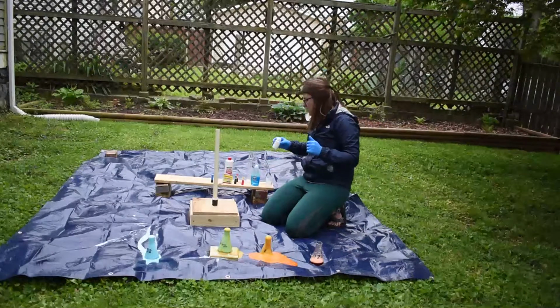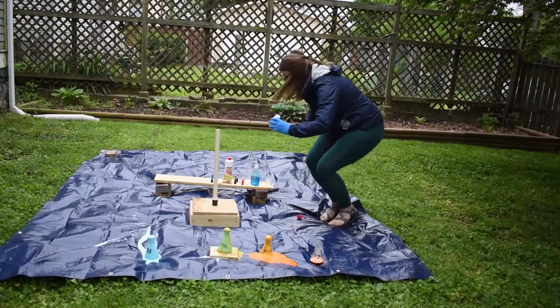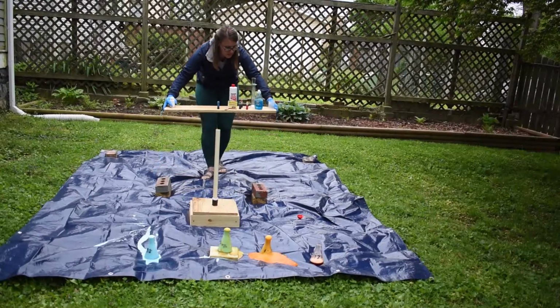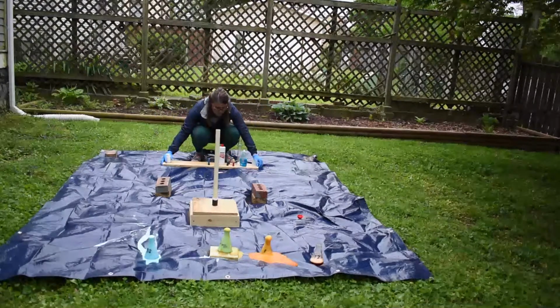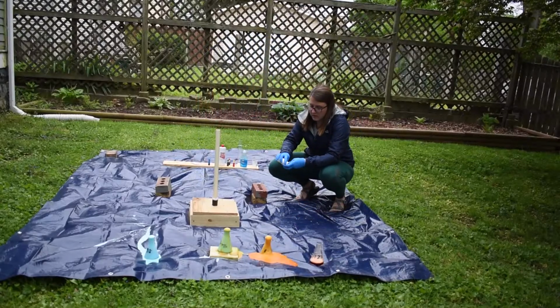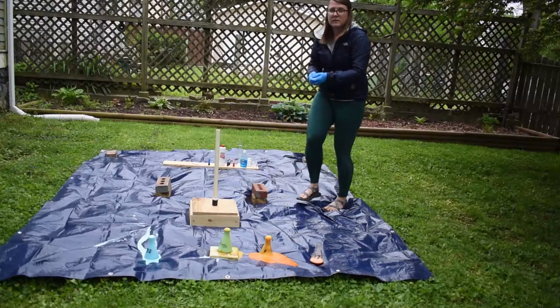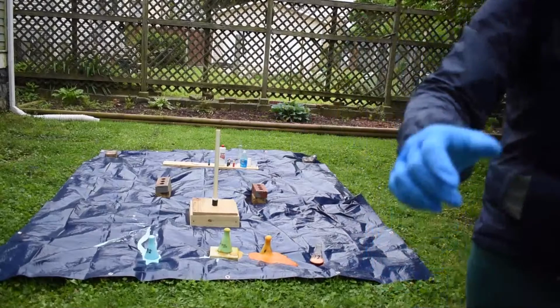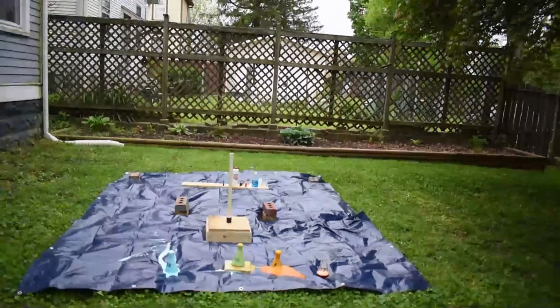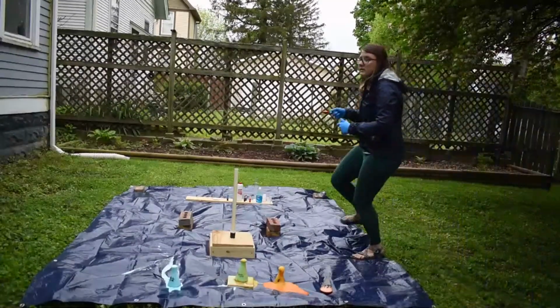So we've got that. We have the potassium iodide that I have left. I'm going to move back my other stuff just in case, because I have a feeling of all of these, this is the one that could make the most mess. I got my teaspoon. I don't think we forgot any ingredients this time. Make sure everything's all the way zoomed back. Let's try to go up a little bit. Yes. Okay, I'm going to dump it and get back.